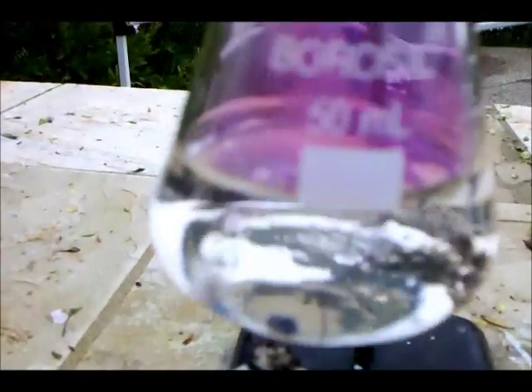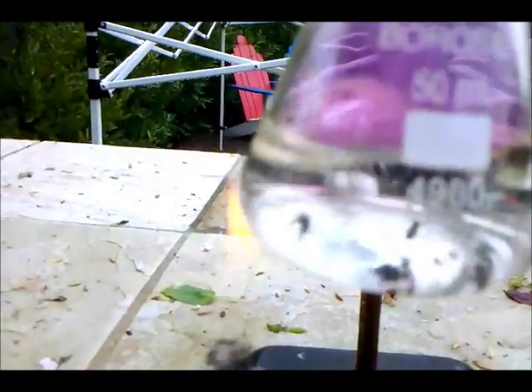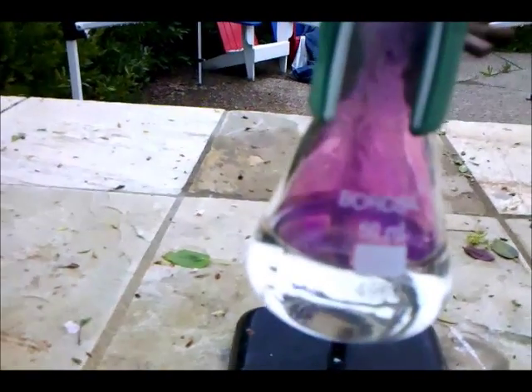Now we can see the reaction beginning to start with the iodine boiling around in the solution. As soon as the iodine stops dissolving, the reaction is complete. Also we can see some iodine vapor leaving the flask, so this will affect our yield if we lose some iodine to vapor.